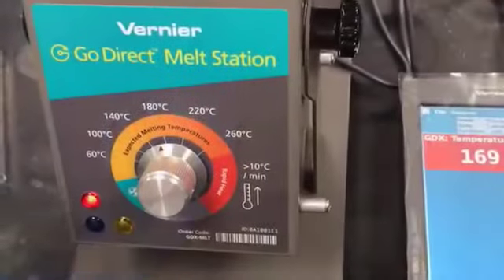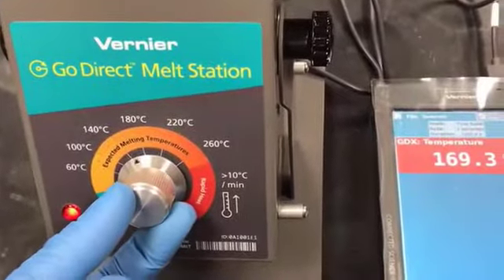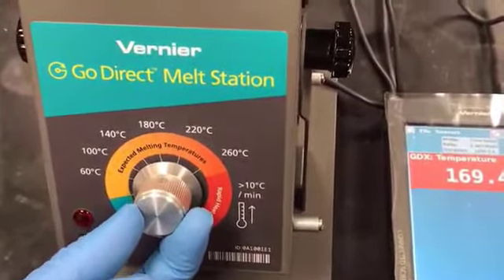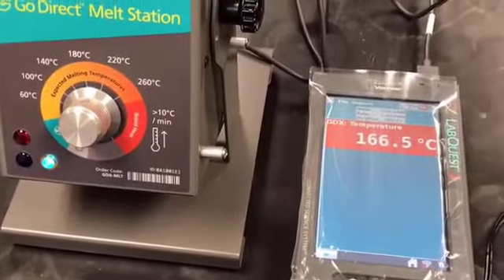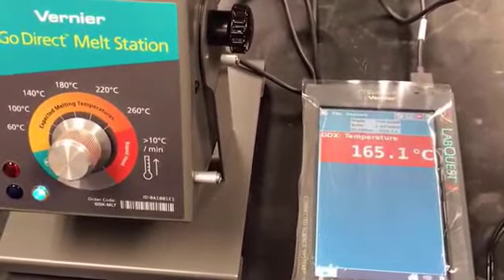So now we are done with the melting point recording. Now I'm going to turn on the fan of the machine in order to cool it down. Let's say I'm going to record another melting point of fluorene or any other sample. So the machine has to be cooled down. I don't know the melting point of another sample; maybe it is less than 166 degrees centigrade, right? So I have to bring the temperature down. This is a rapid cooling mode, and that's how you can decrease the temperature of the machine fast.